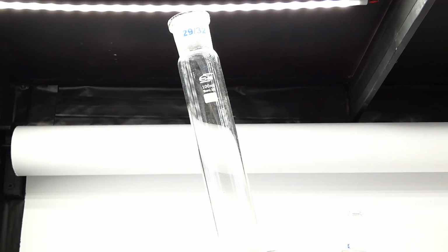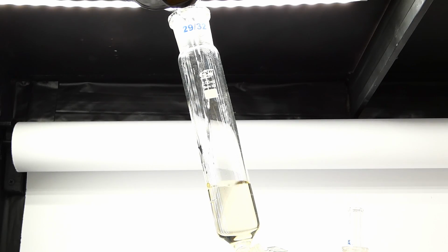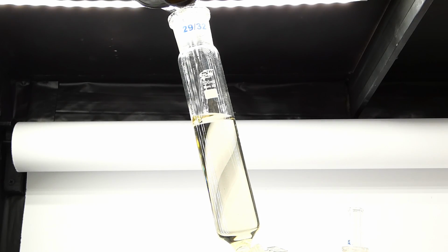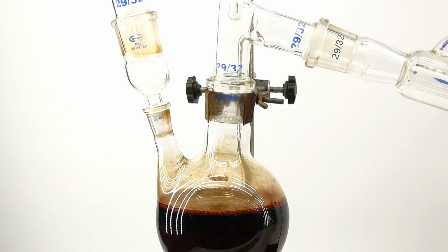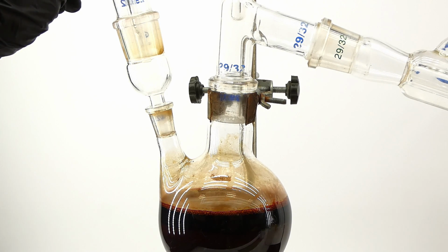Anyway, to start the reaction, I attached an addition funnel to the flask and filled it with 145 ml of 96% sulfuric acid drain cleaner. Before starting the addition, I realized that my flask was a little too small to contain everything, but it just so happens that I don't have a bigger one, so I just prayed to the chemistry gods to make this work and started the sulfuric acid addition.